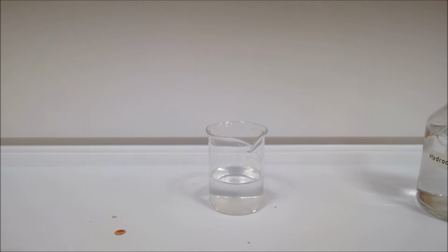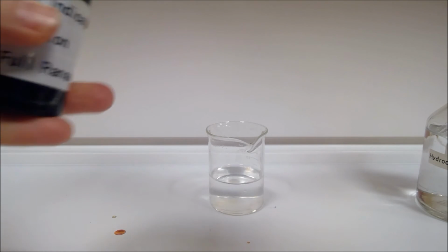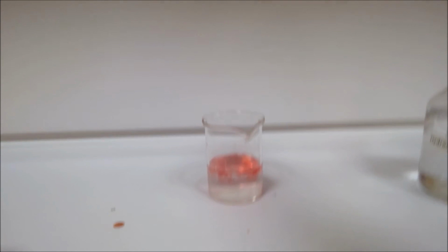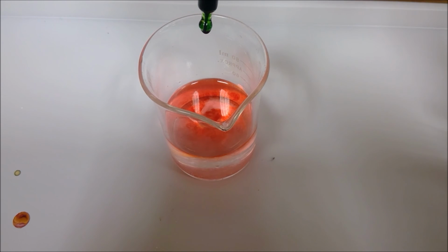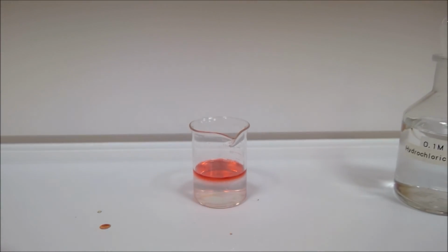And then the universal indicator. So you might think ahead, what do you expect from our phosphorus oxide here? There we go. I'll move this above, it's quite fun seeing the indicator change. So as it disappears out, the red, the green just disappearing out to the red. There we go.